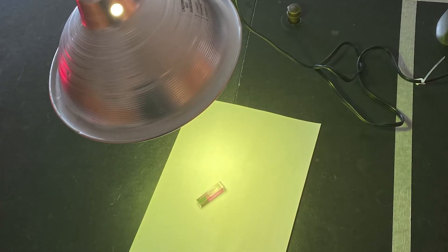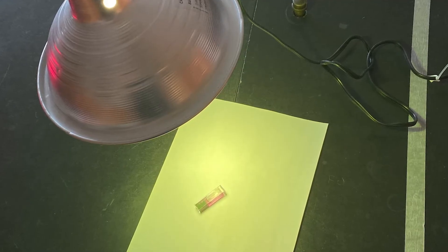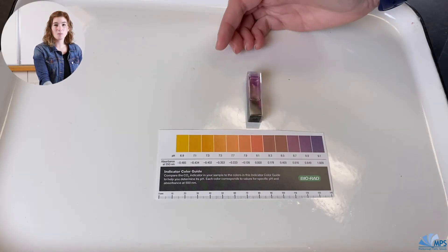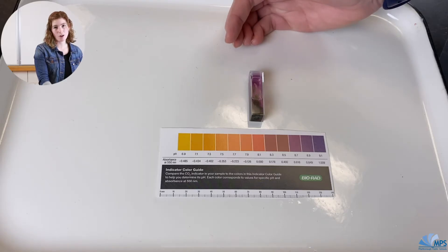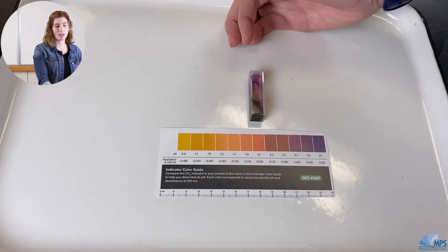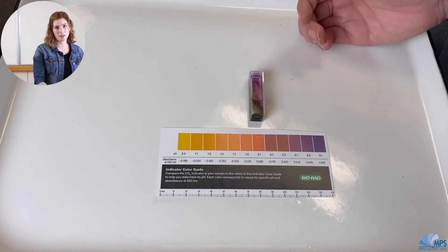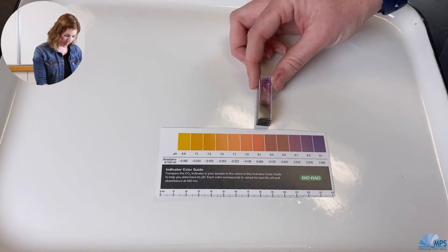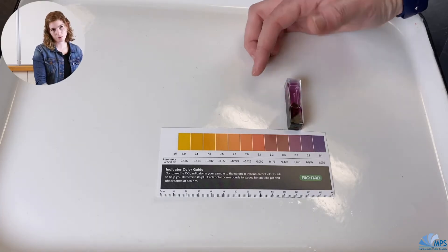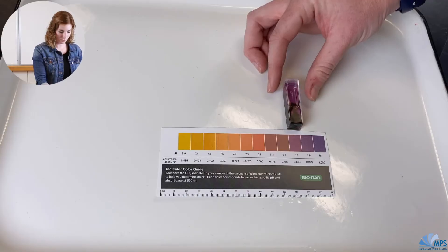The next condition was a green light, and you can tell I do see a purple color, but it's not as deep as it was under the white or red light. This makes sense because under green light a lot of that light is reflected and not absorbed, which should diminish the amount of photosynthesis that's able to happen — but I'm still providing light, so we'd expect a little to occur. This one matches best with a pH level of 8.7.